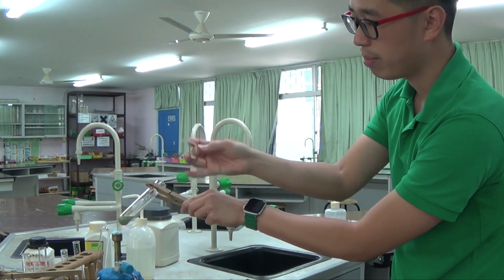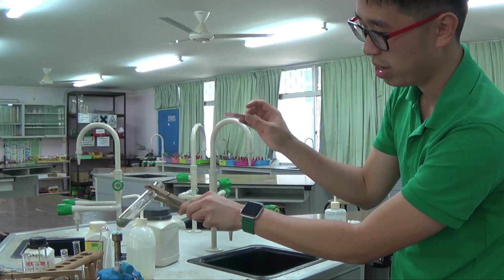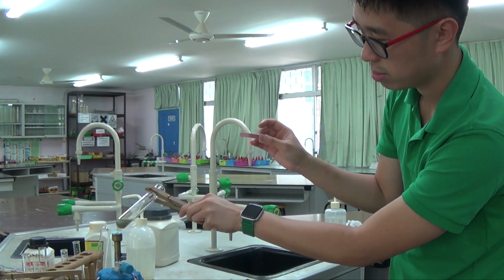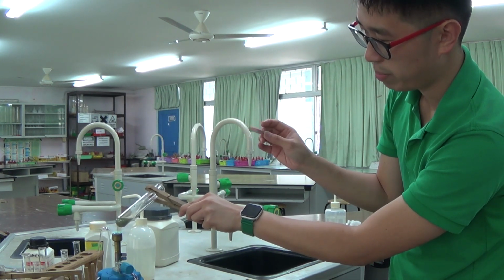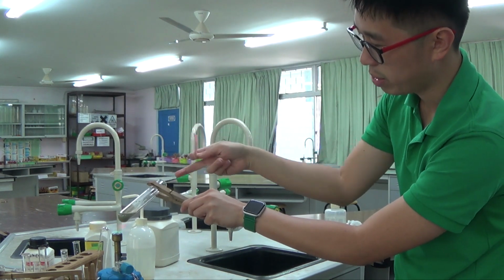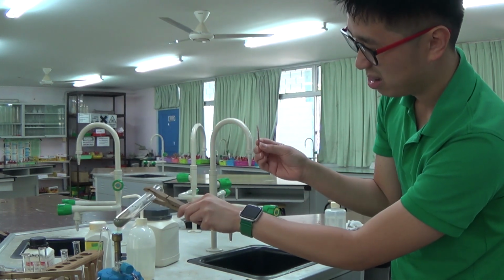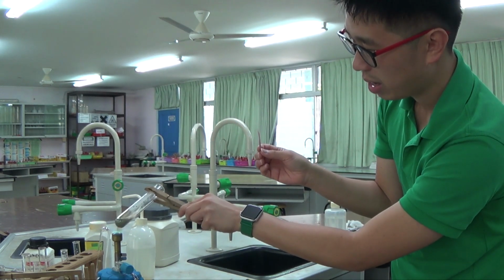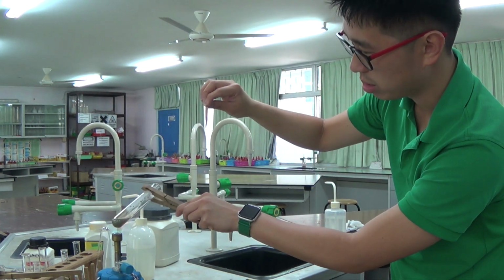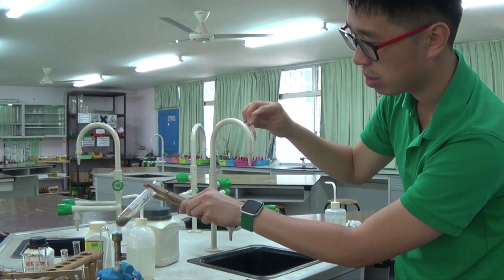Okay. So let it boil for a bit. Make sure it's completely swirled. Let it boil for a bit, and then test for the gas that's given off. You should be able to smell the pungent gas if you take a whiff of it, or sometimes you can see a little bit of vapor being given off, because they come off as steamy white fumes, alright? So it takes some time, and there's a bit of sound saying that it's starting to go. I'll just wait until it's kind of boiling, and then I'll bring it close to the camera so that you can see what is going on.